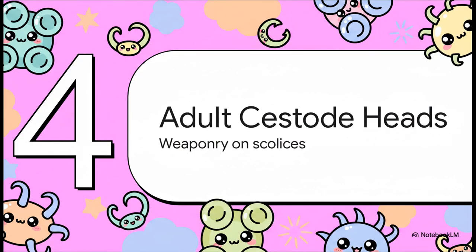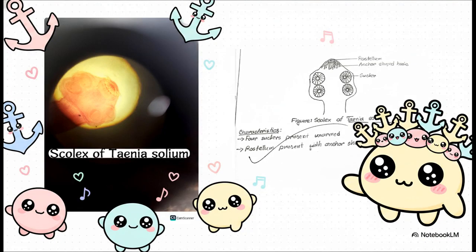Moving up to the fully mature adults, let's examine the fascinating weaponry found on their heads, scientifically known as scolices. Taenia solium is literally armed to the teeth. Notice how the very top portion, the rostellum, features a prominent crown of hooks. But pay really close attention to the shape. These hooks look exactly like heavy medieval boat anchors. Combine those anchors with 4 unarmed round suckers, and your sketch is complete.